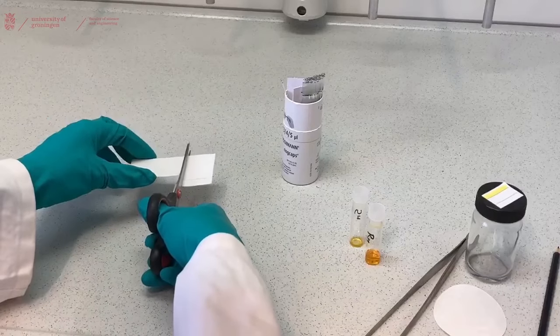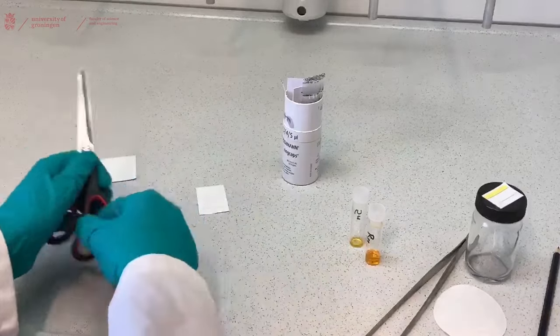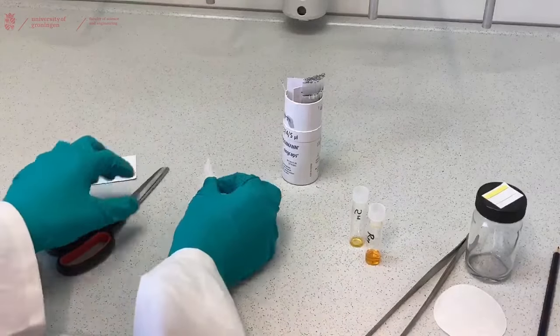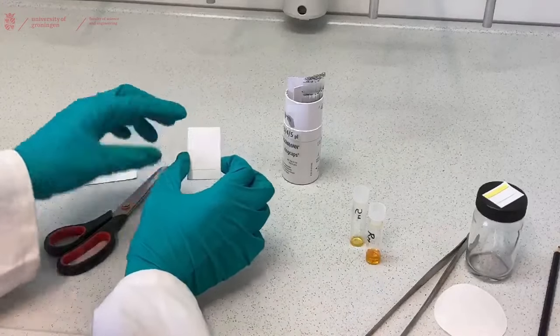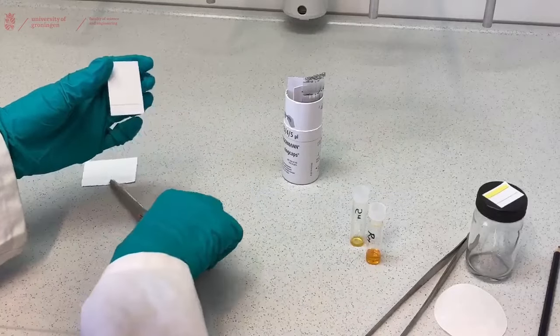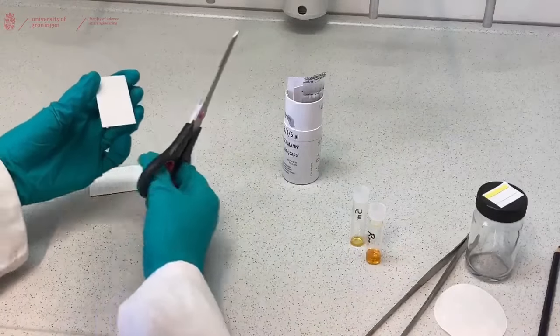Make sure that you make a clean cut through your TLC plate in one go and that there is no damage to the edges of the TLC plate, because that will ruin the separation when your solvent is flowing through your TLC plate.